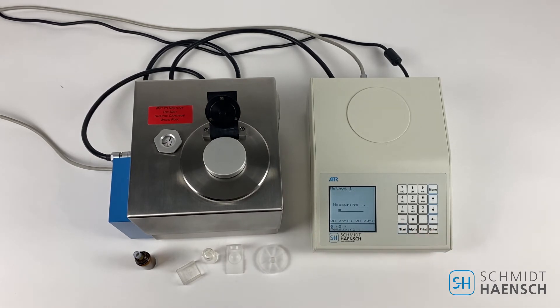Now we are ready to measure. Press start. You can expect the measurement results within 20 seconds.